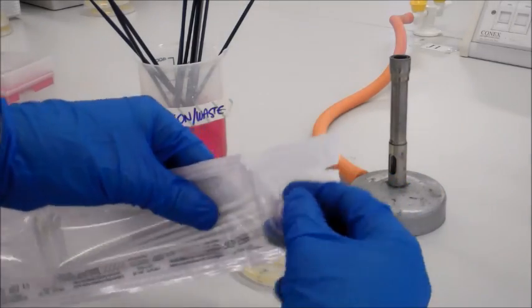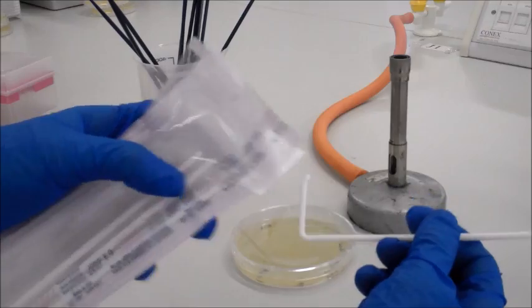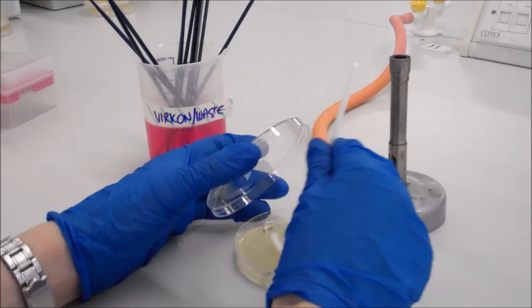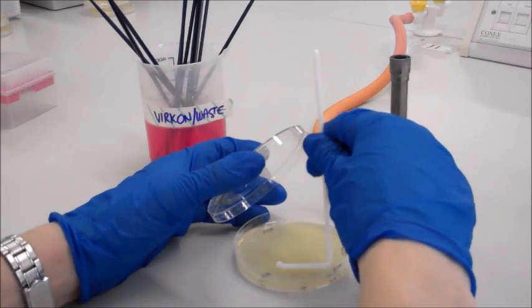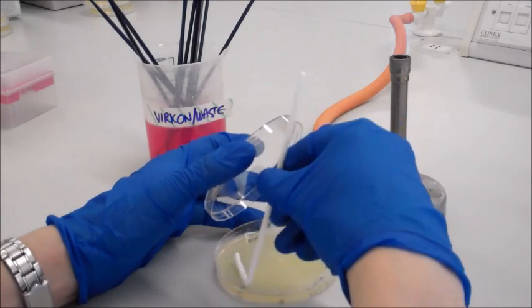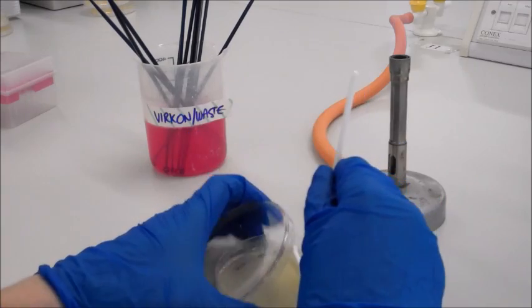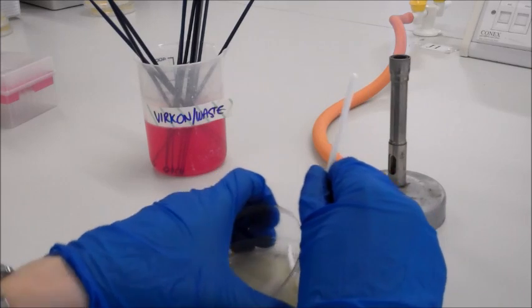Next, open a sterile packet of spreaders. Take one out and carefully reseal the packet. While only lifting the plate lid off as much as you need to, start spreading the culture onto the agar with the spreader. Make sure that you get the culture into all the edges of the plate. An easy way to do this and get an even spread is to hold the spreader still and spin the plate.